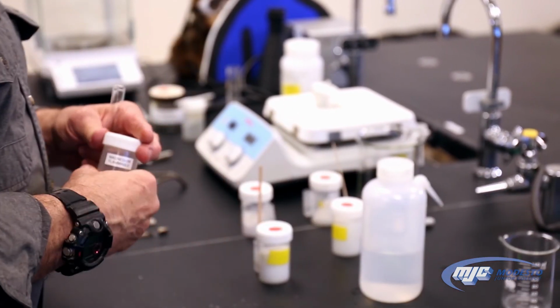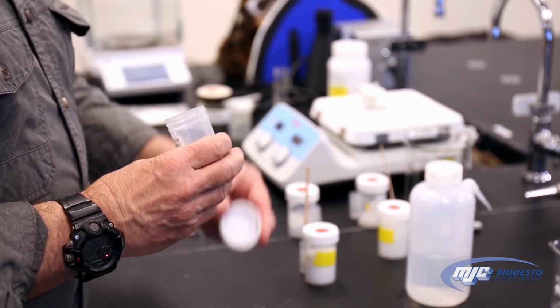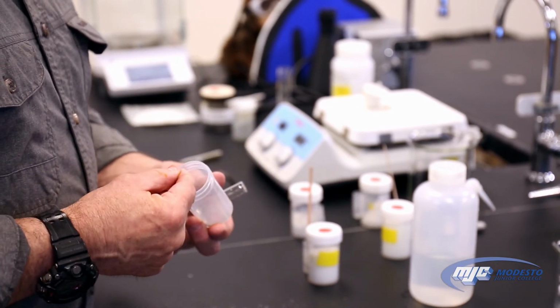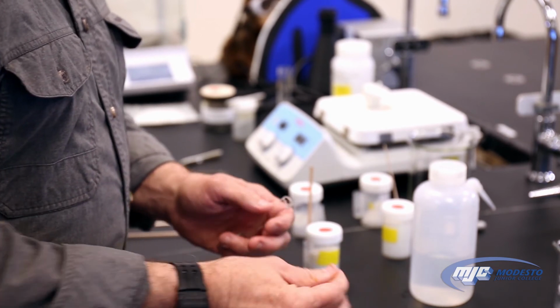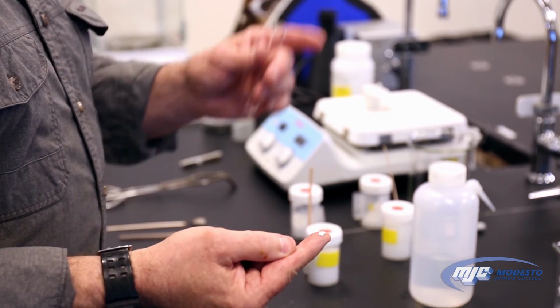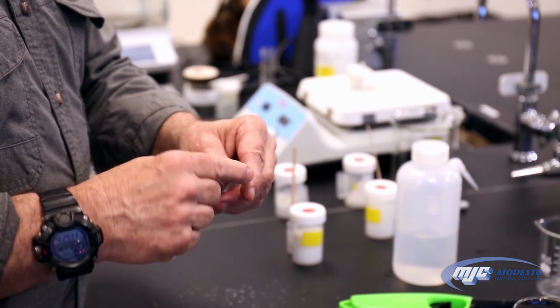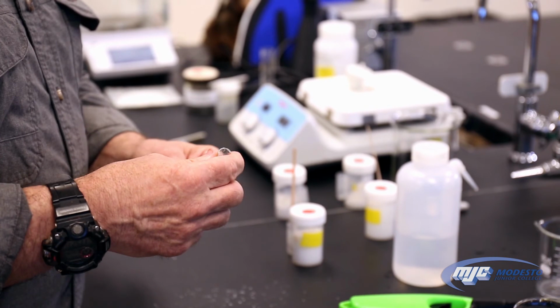Then we take a magnesium ribbon, just a little tiny piece of magnesium. We only need one, they're pretty small. So it's important, by the way, to remember what it looks like. It's this shiny silver metal. And put it in there. So we have two.